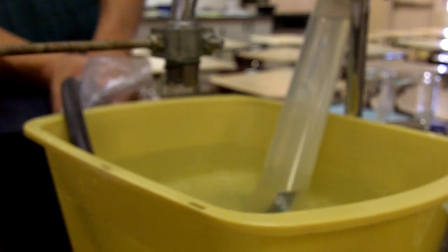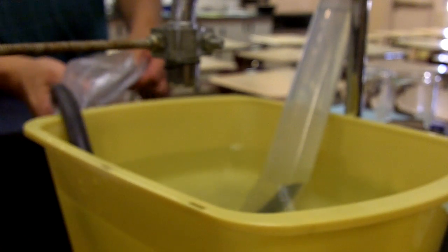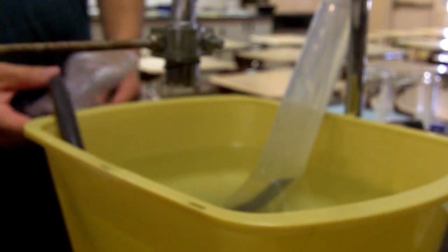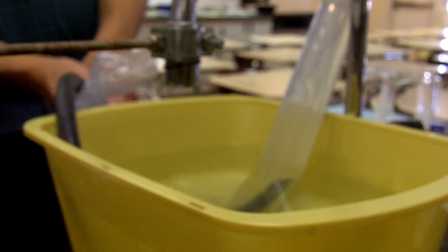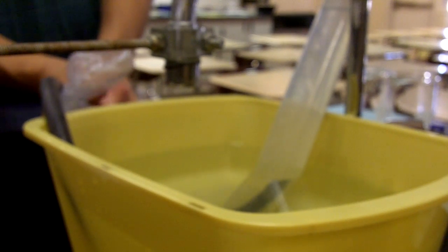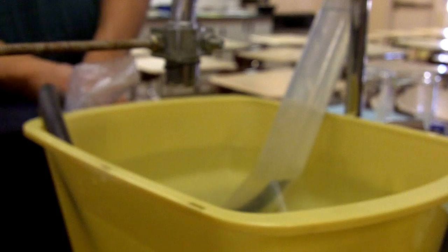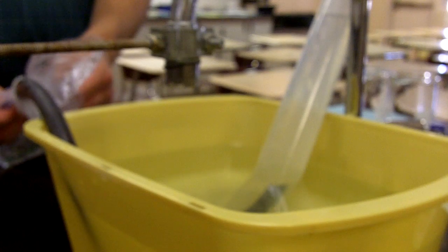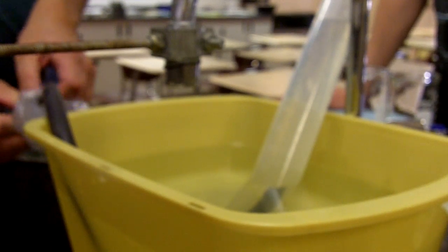Alright. Does that look like all of it? Looks like it. Yeah.